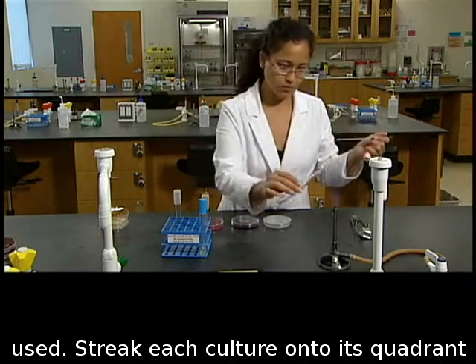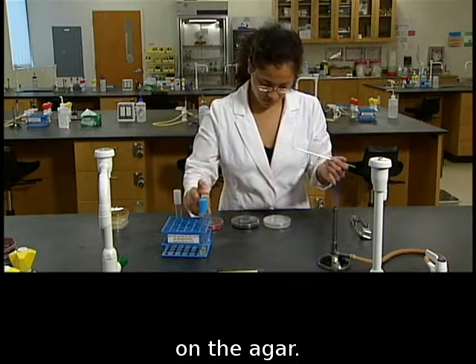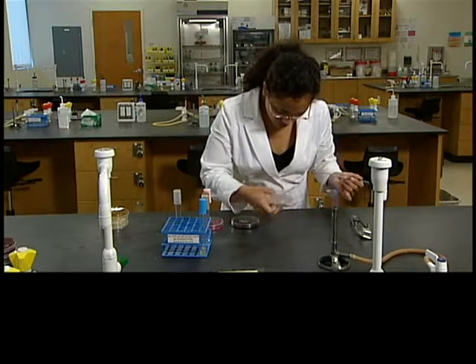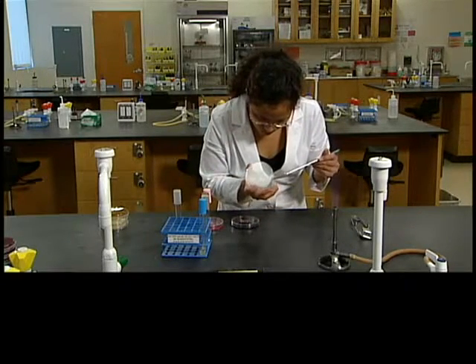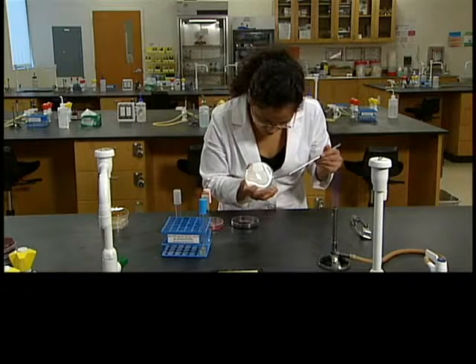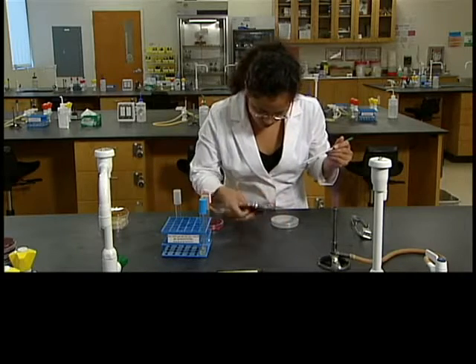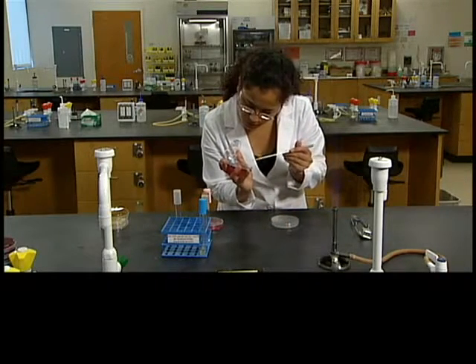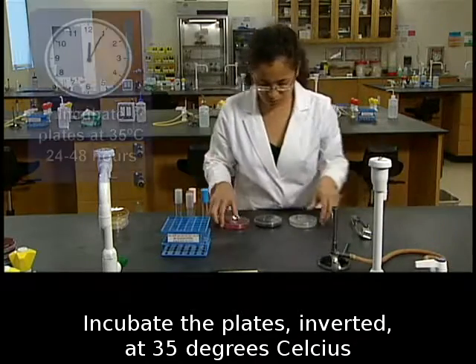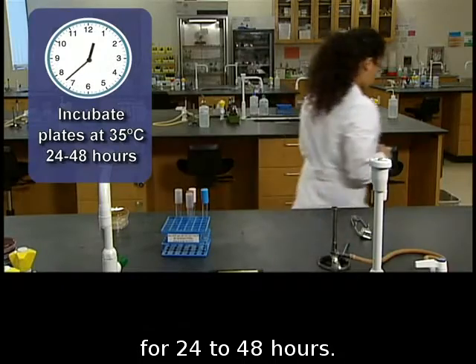Streak each culture onto its quadrant on the agar. Incubate the plates, inverted, at 35 degrees Celsius for 24 to 48 hours.